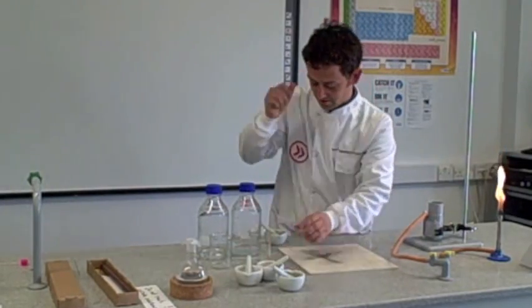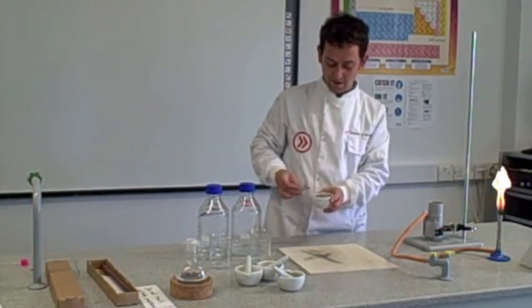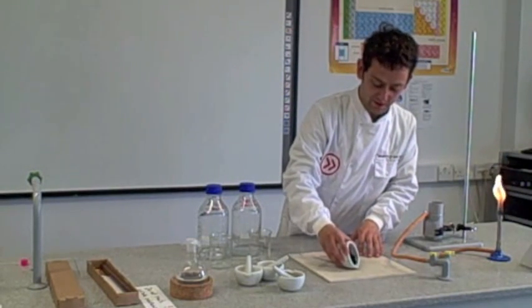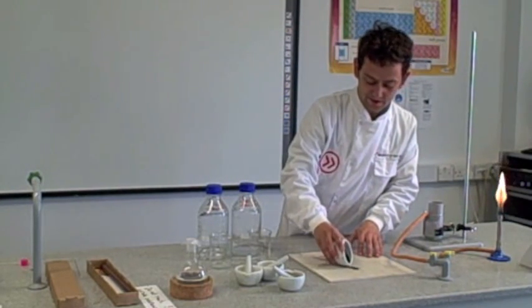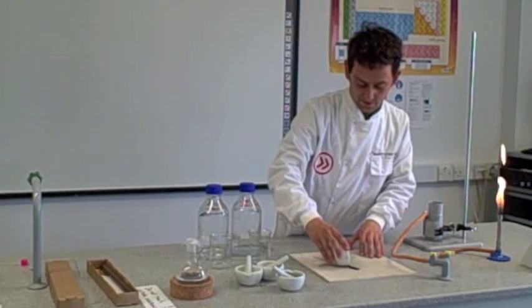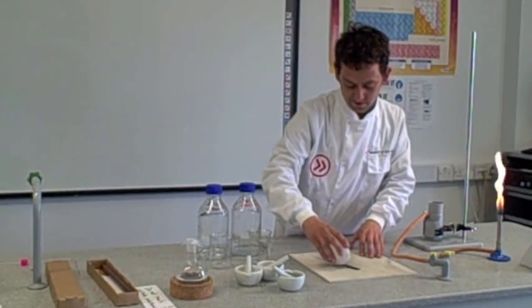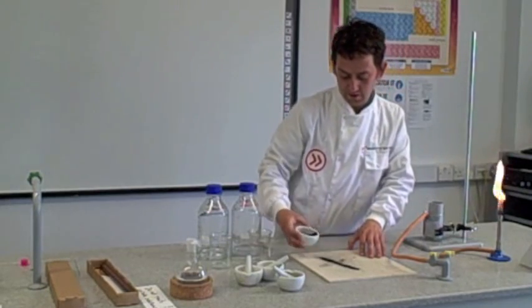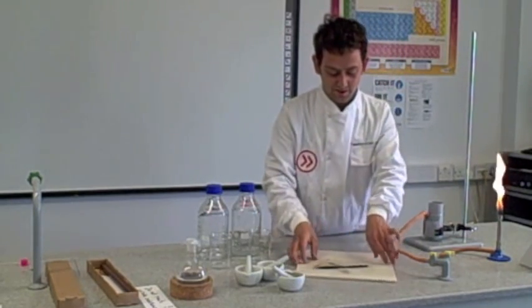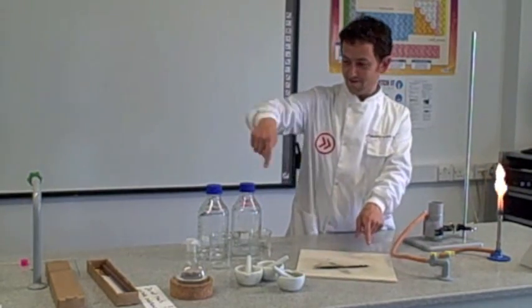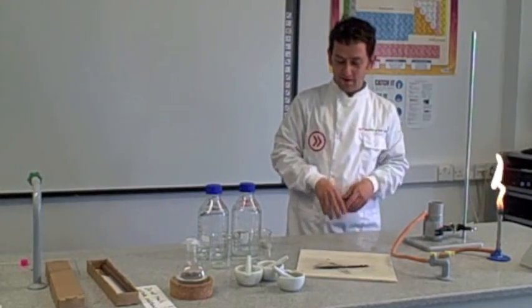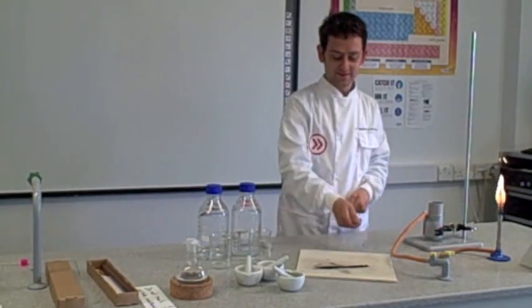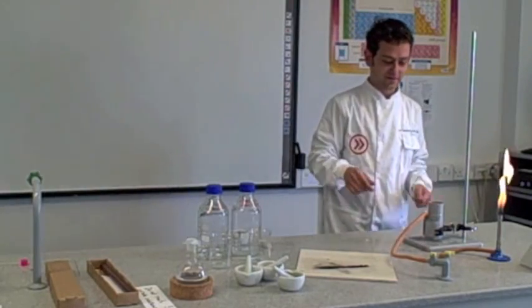So if I demonstrate the ignition of gunpowder. As you can see, I've done some before. It's a piece of heat mat. We'll pour this into a little line. And it will act as a fuse. For instance, people would put a big long line of this and then put an explosive at the other end. And they would light this side and it would spark all the way down like you've seen in movies.